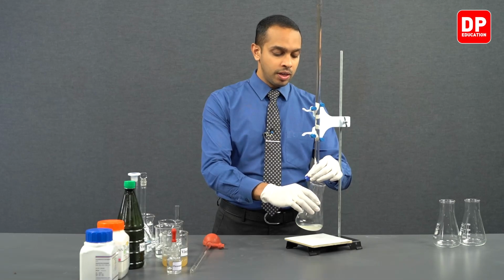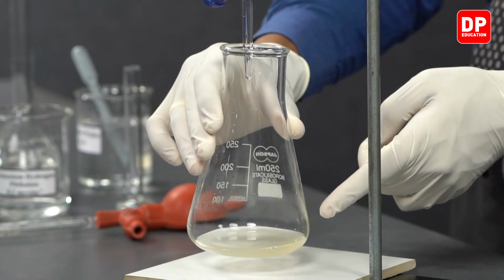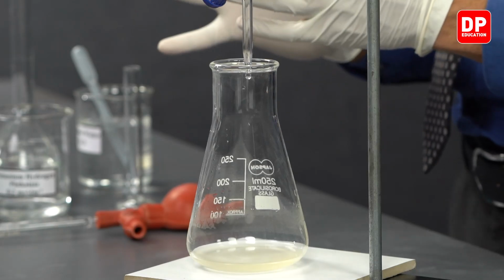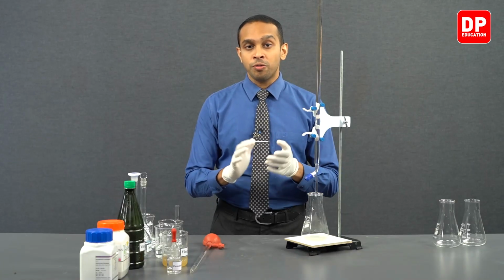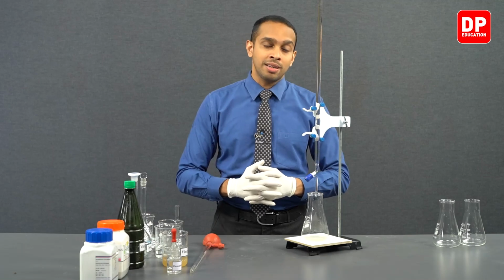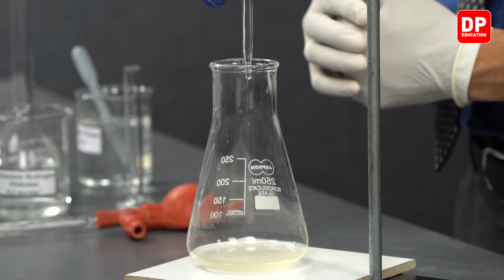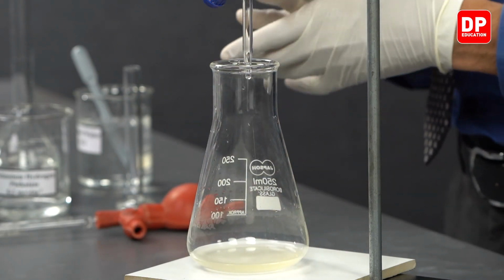Just like in our previous titrations, you can observe as sodium hydroxide enters the solution, that area of the solution turns pink. This is because phenolphthalein, when it comes into contact with OH- ions at high pH values, will display a pink color. However, this medium that we have over here is acidic.